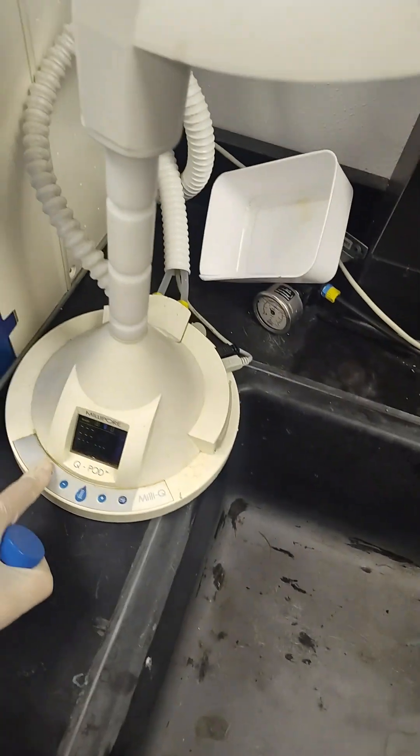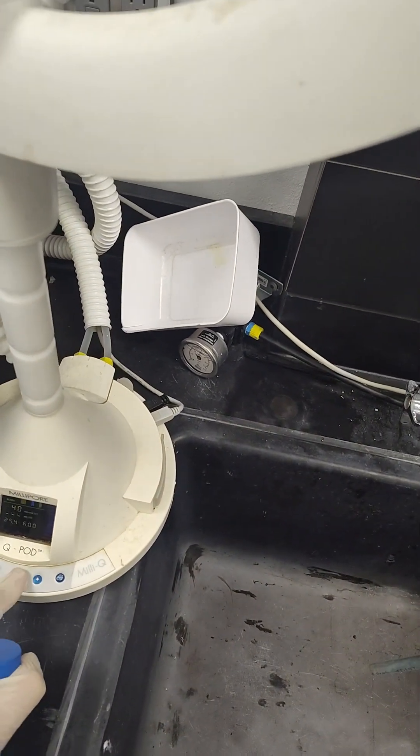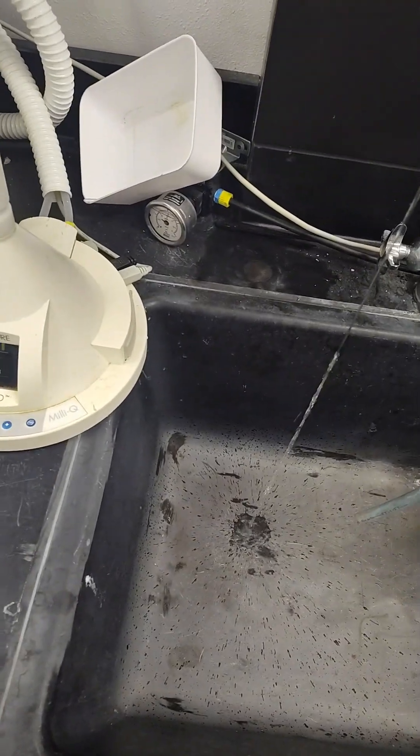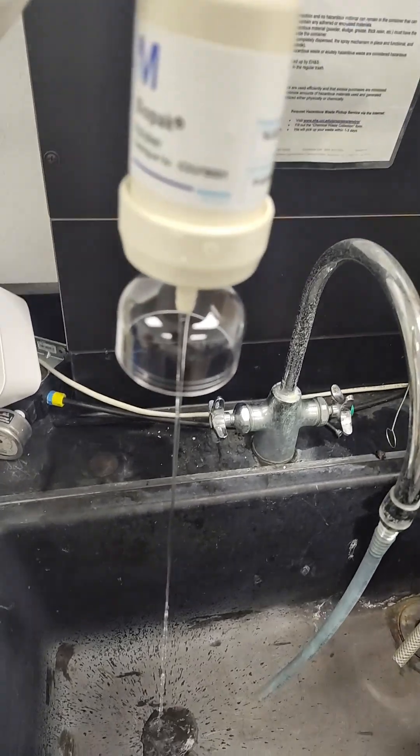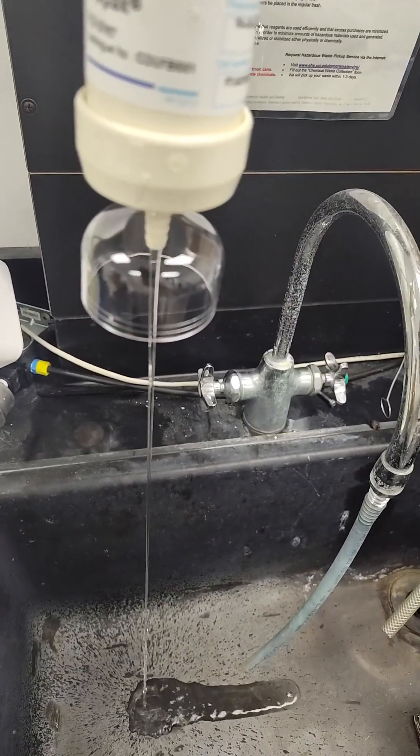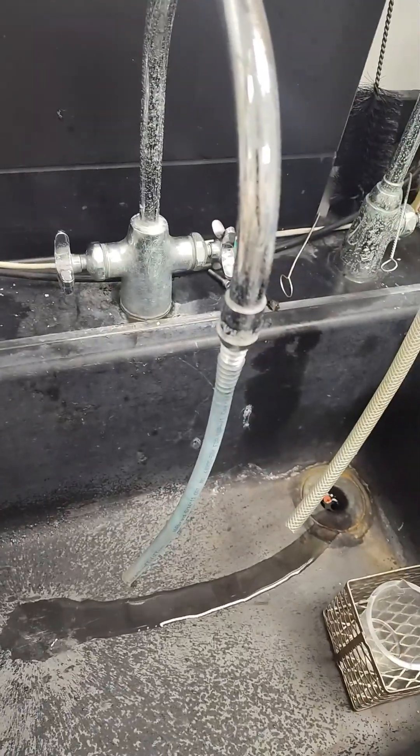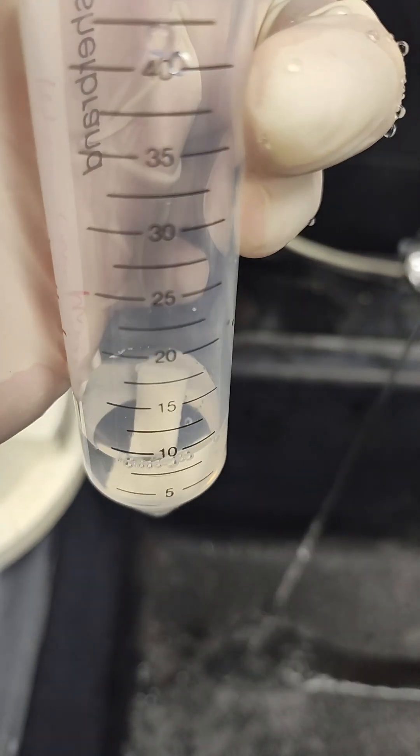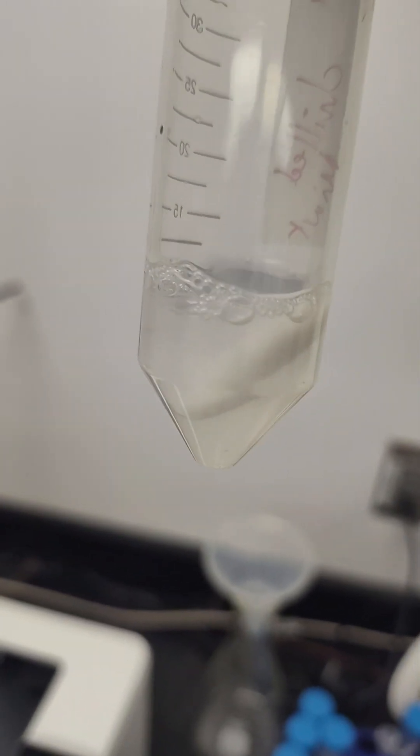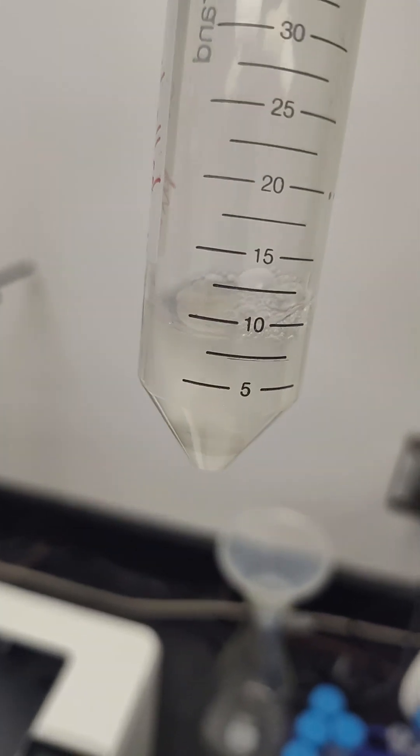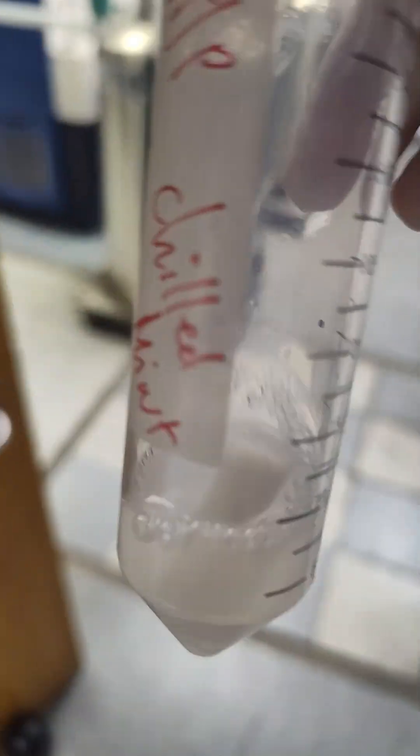All right, do about 10 mLs of MilliQ water. It's like a trickle of water. That's not doing it, at least it's 18.2 megohms but it's not. It's been sitting for about 30 minutes. Pretty cloudy, similar to Zyn cloudiness I'd say, so pretty well extracted with water. Now let's go ahead and DCM liquid extract it.